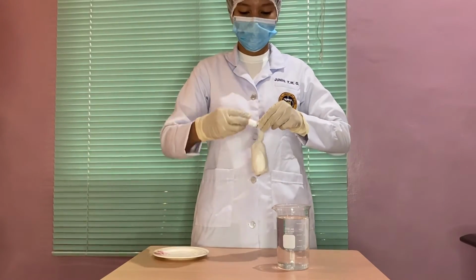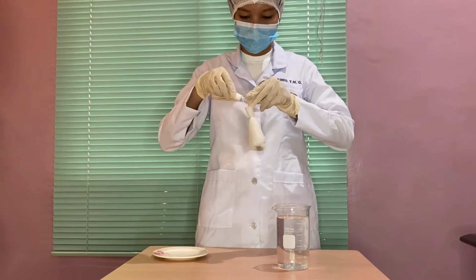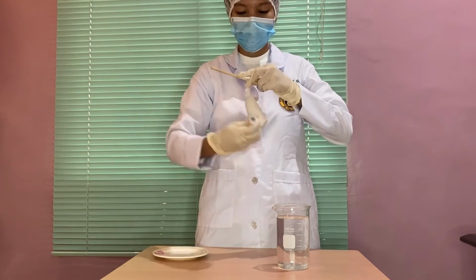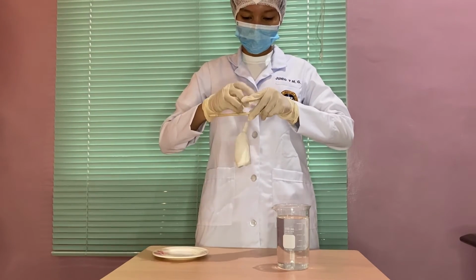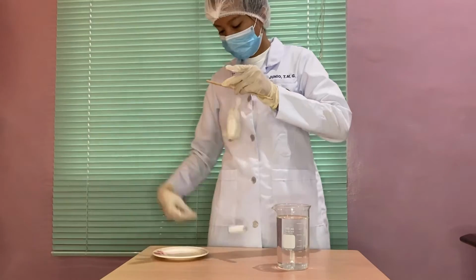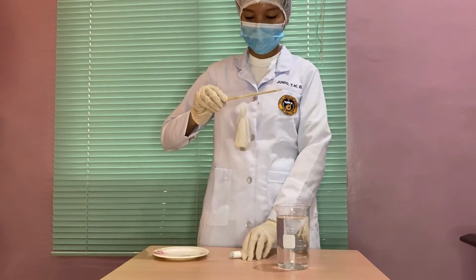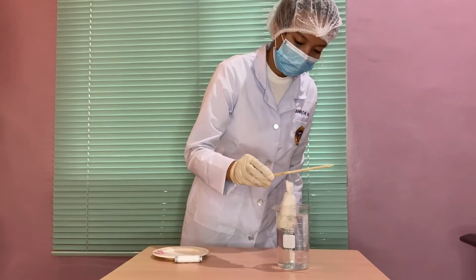Fourth step, suspend your tissue in the decalcifying agent by means of a thread to ensure complete decalcification and to protect the tissue from any precipitate that might be settled at the bottom of that container. Did you know, in the actual procedure, the thread used in this method should be dipped in melted paraffin wax to avoid the destruction of the thread by the corrosive activity of the acid.